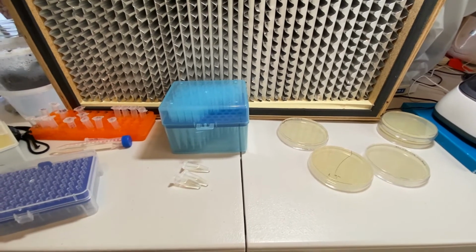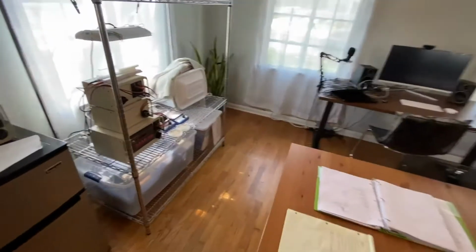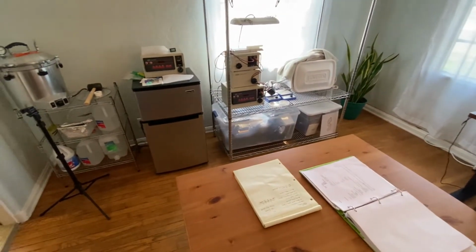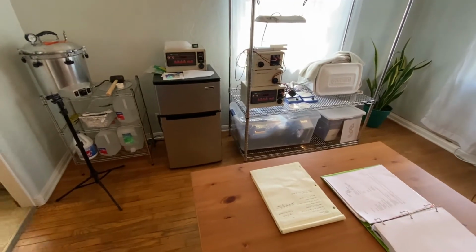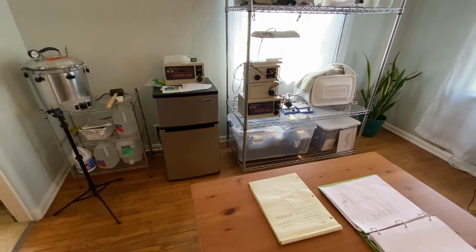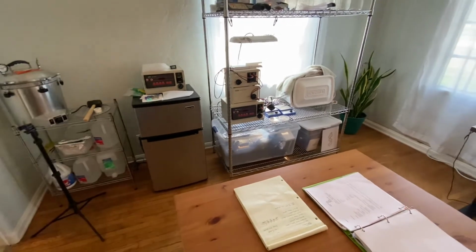We'll use glycerol, we'll use a higher voltage. So we have a lot of things we can try, a lot of variables, and we have much more work ahead of us, but we're making good progress and we're learning. And this is the process of DIY bio, especially if you're alone and you're just trying to figure things out. It's a ton of trial and error, but I'll tell you what, every single time I run this, I'm getting more comfortable with it. I'm getting better at it. We have a transformant. So now we're just working on optimizing it and cleaning up the rough edges.